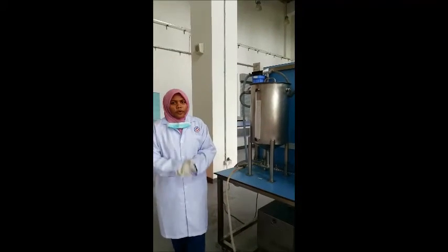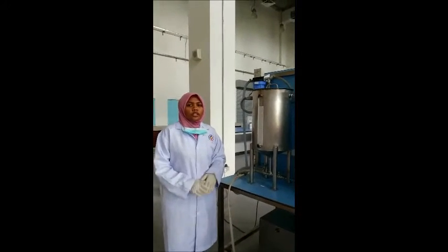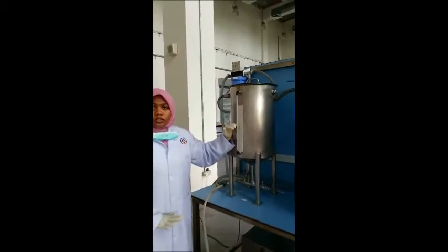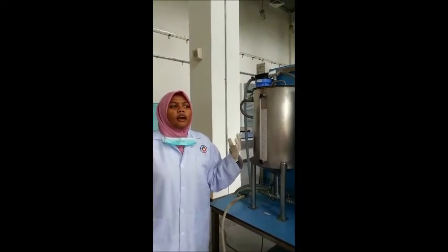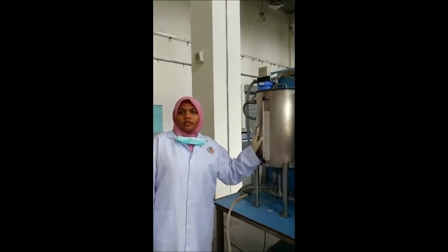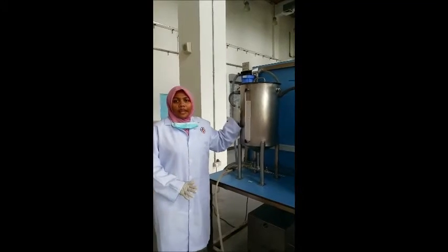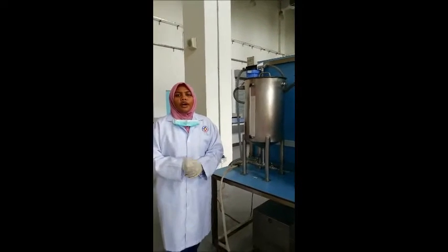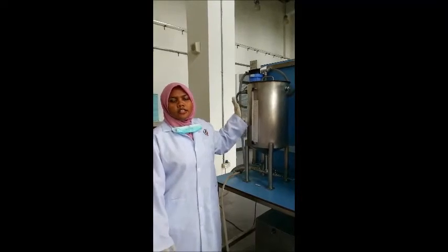Okay, now to start the experiment, we should prepare 20 liters of ethyl acetate solution in tank 1. This is prepared by first adding the water, 19.2 liters of deionized water, and then we add 800 milliliters of ethyl acetate. As a precaution, ethyl acetate must be put inside the tank that has been filled with water. We cannot just pour the ethyl acetate by itself into the tank because it will damage this machine.